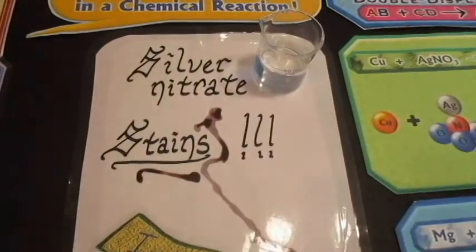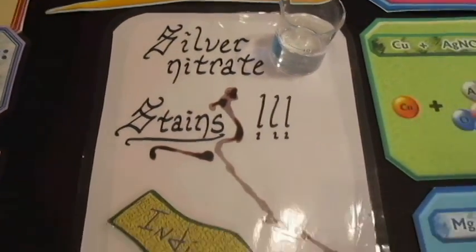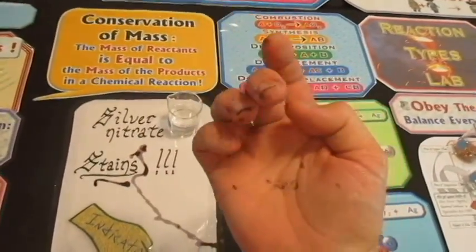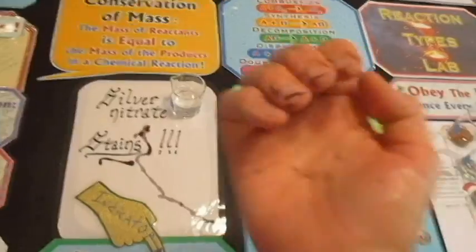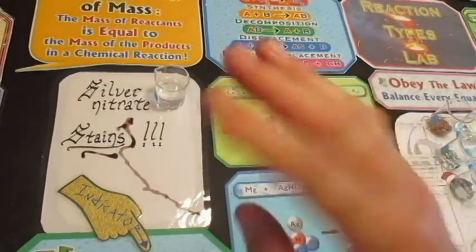And there's a really particular chemical that we're going to watch out for in this lab, silver nitrate. Silver nitrate can turn your skin into a weird color. I can show you. I'll take off my glove and put a new glove on. I got an exposure from a demo that I did. I wore my gloves, but then when I was cleaning up, I got some on me. So see that weird color? You probably don't want that.